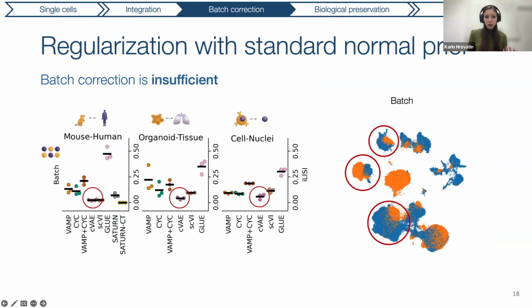Now, one important thing to note about cVAE integration is that it is actually relatively insufficient and low in comparison to other methods that I'm going to explain in the rest of the talk. So what you see here, higher batch correction is better, and I circled the cVAE model across 3 different data sets. You can see it is constantly performing very poorly. And on the right, you can see one selection of integration where I try to select a good balance between batch correction and biological information from the different parameters I tried. And as you can see, the batches are actually not mixed very nicely.